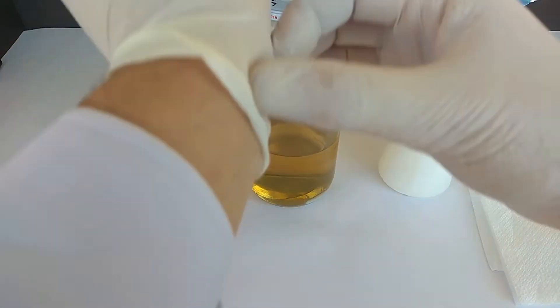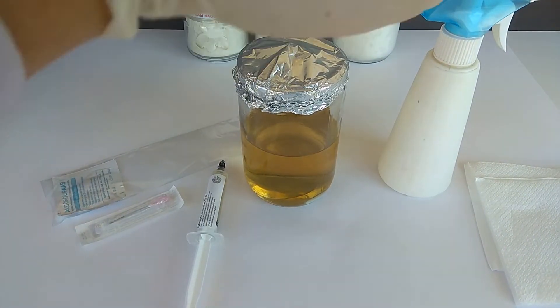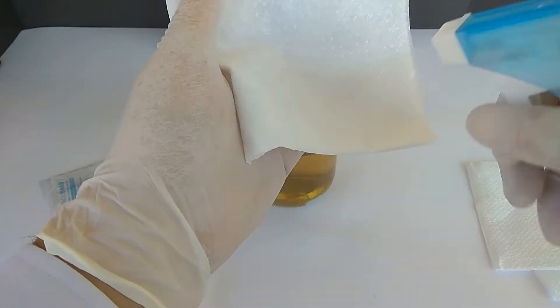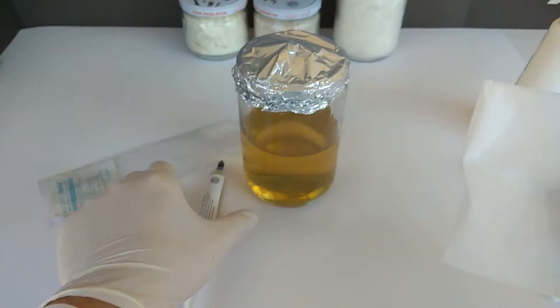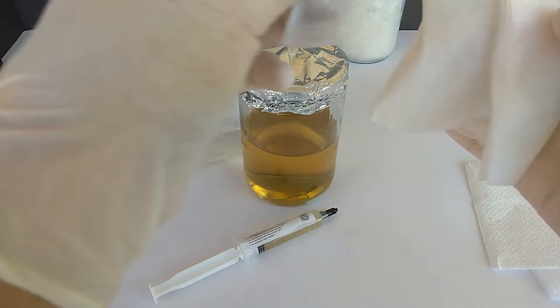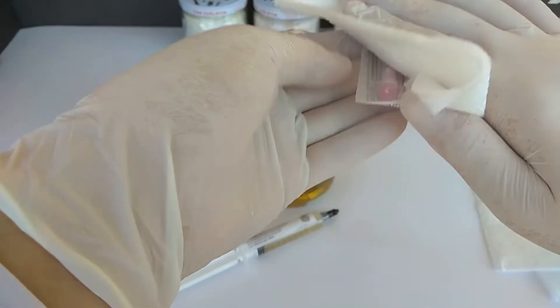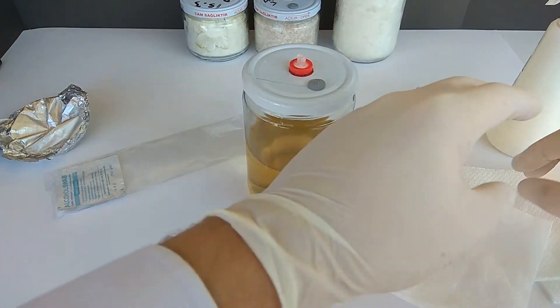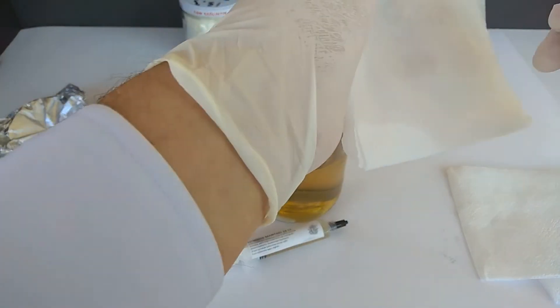I will use mask and gloves today for hygiene reasons. Even our breath can carry airborne mold spores and bacteria to the metal tip of our needle. That's why we have to be careful. I clean all materials with isopropyl alcohol. Specifically, I thoroughly wipe the lid and injection port with alcohol.